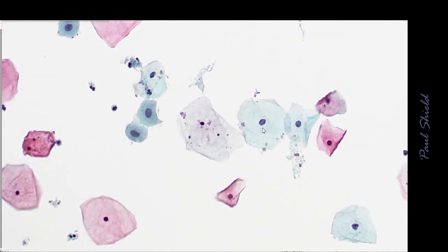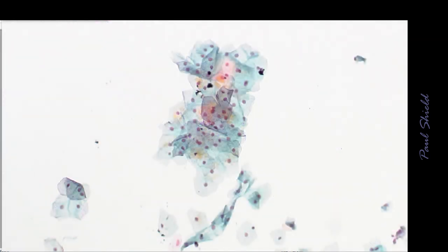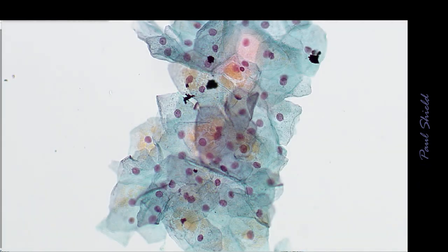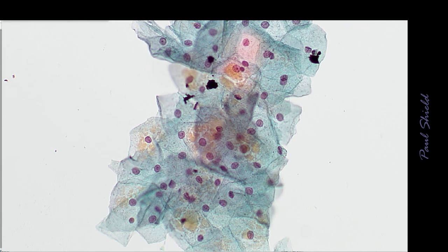You can see that all of these cells have quite a lot of cytoplasm, so it's a low NC ratio. The NC ratio is higher on these less mature cells. This is a group of intermediate cells, and you can see they're just loosely mashed together, and they're quite uniform in size and shape of nuclei, especially fine even chromatin. Notice the typical squamous cytoplasm. This is called homogeneous and dense, and it has a really well-defined border to the cell.